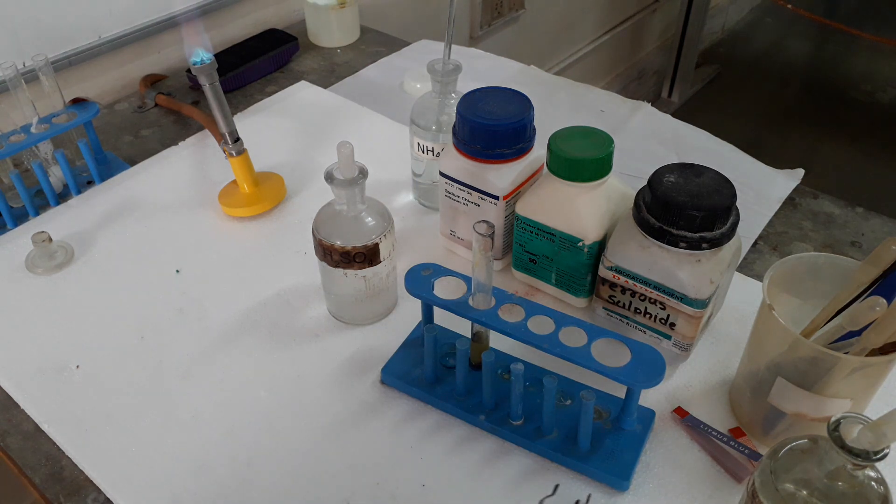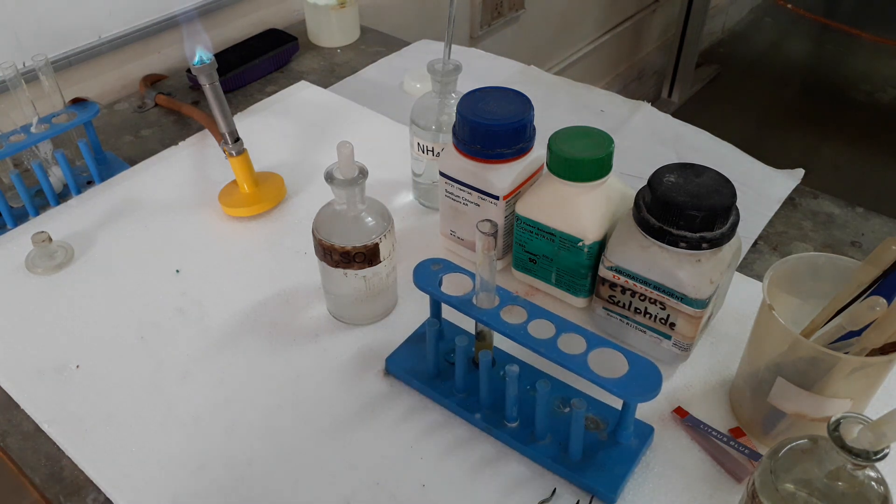So these are the other three anions: chloride, nitrate, and sulfide detected. Thank you students.